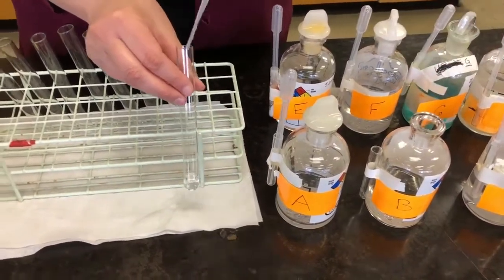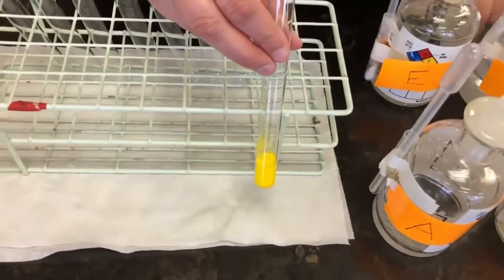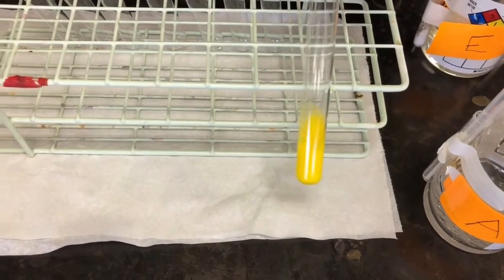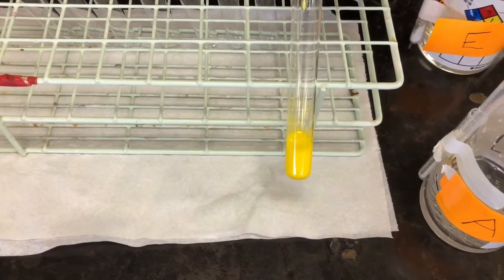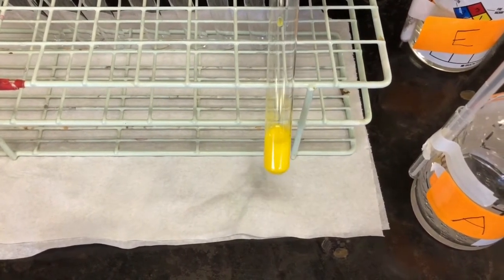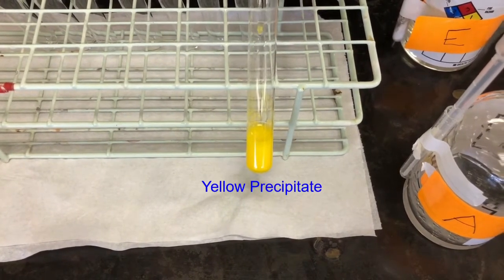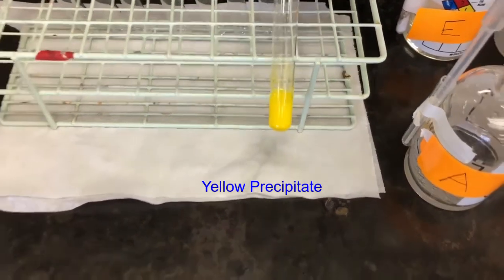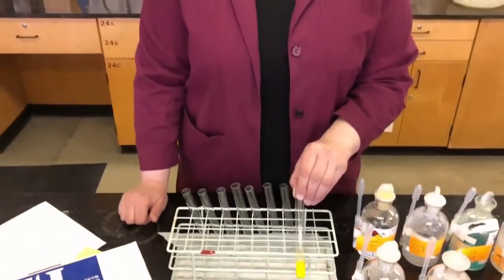Same thing, 1 milliliter. And you can see as soon as I add it, we get a color change. That is definite evidence of a chemical reaction. You see that it's a yellow color, and you should also be able to see that there is a precipitate being formed there. A precipitate is a solid that forms when we mix 2 liquids together. So we have a yellow solid being formed. Our observation in this case is that 2 colorless liquids mixed together, and they produced a yellow solid product. That's what we observe. What we can deduce based on that is that a reaction occurred between A and B that produced a yellow precipitate as one of the products.